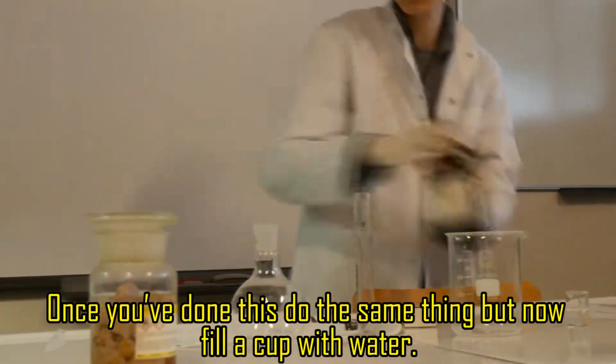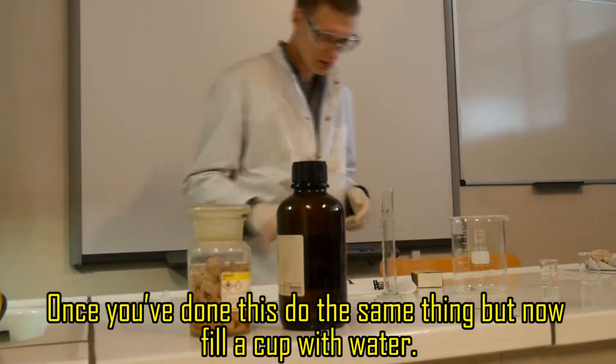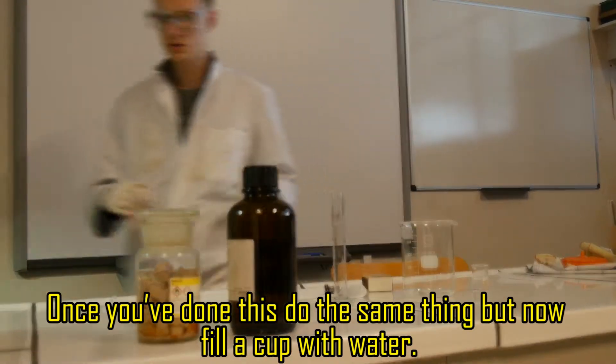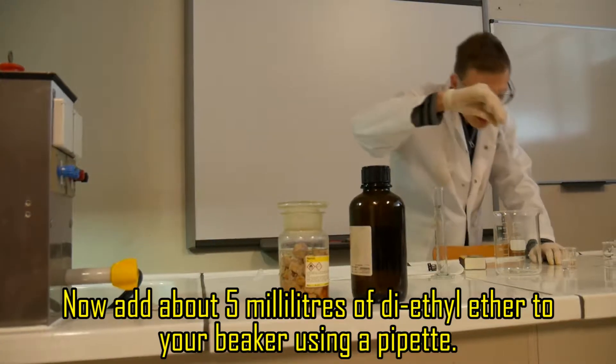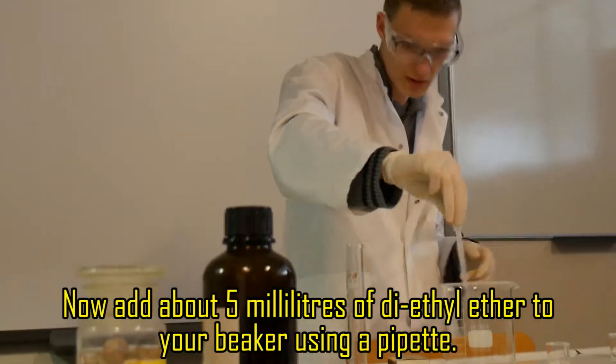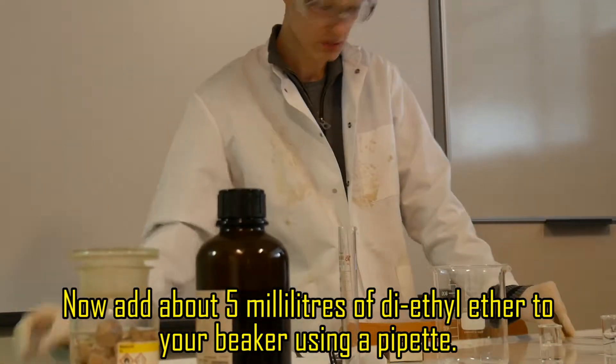Once you've done this, do the same thing but now fill a cup with water. Now add about 5 milliliters of diethyl ether to your beaker using a pipette.